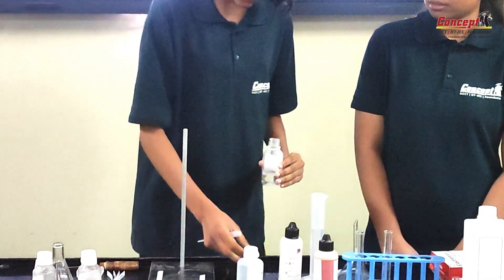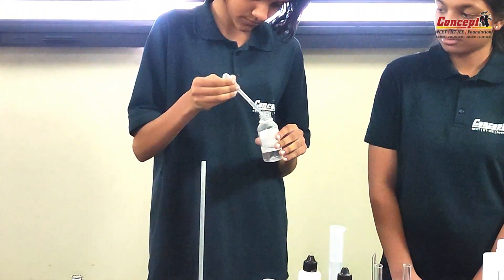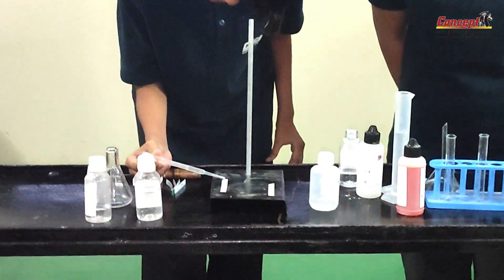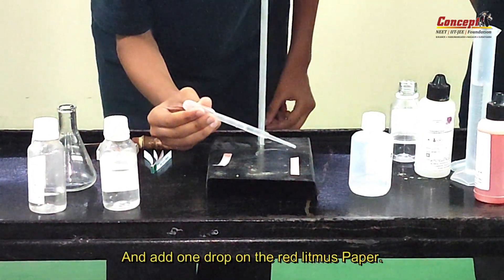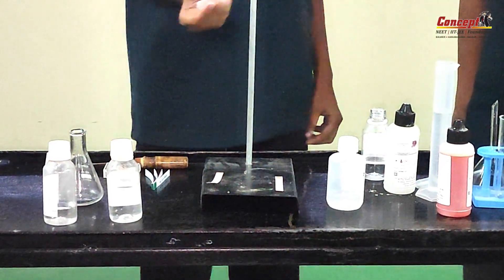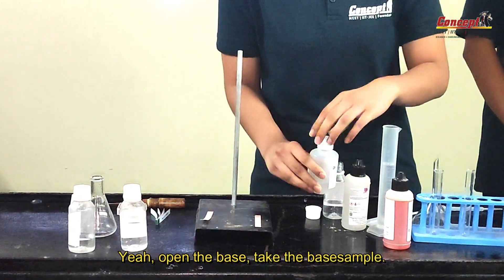Take a small amount of acid — yeah, this much is enough. Now slowly add one drop on the blue litmus paper, and add one drop on the red litmus paper. Put the extra acid aside and open the base.